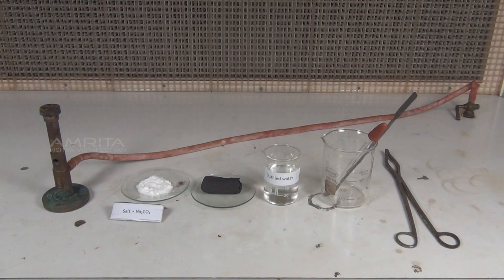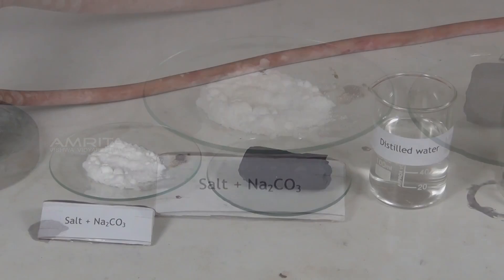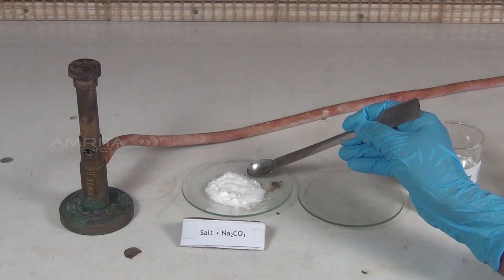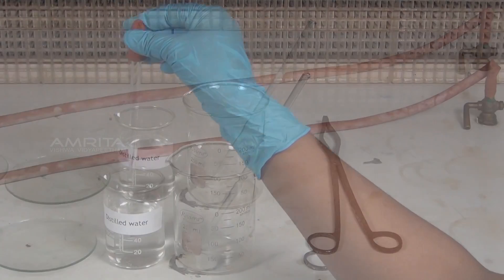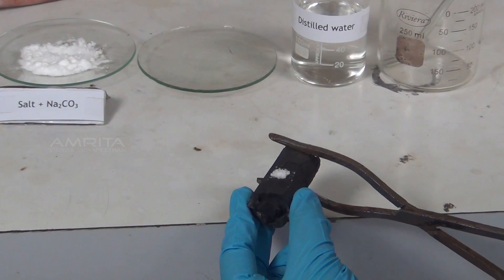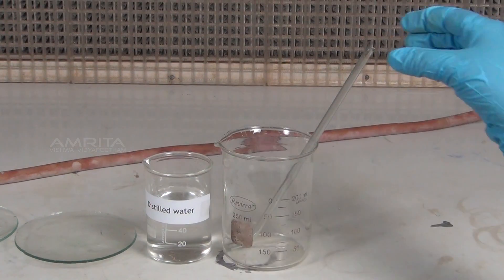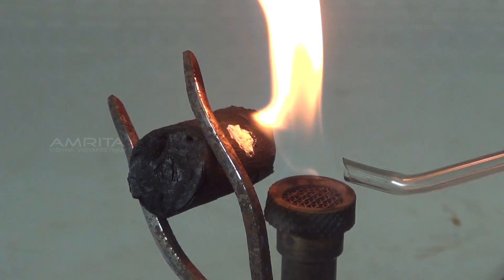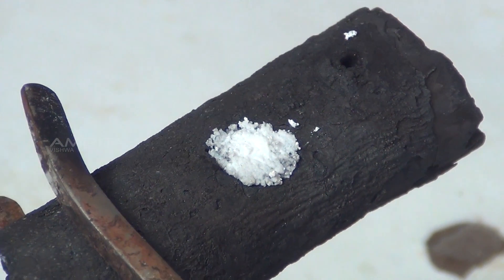Procedure: Take a mixture of a small quantity of salt and double its quantity of sodium carbonate in a watch glass. Take a charcoal piece with a small cavity in it. Using a spatula, place a small quantity of the mixture in the cavity. Using a dropper, add a few drops of distilled water to moisten it. Using the tongs, hold the charcoal piece in front of the reducing flame of the Bunsen burner. Direct the reducing flame on the cavity by means of the blow pipe and heat strongly for some time.